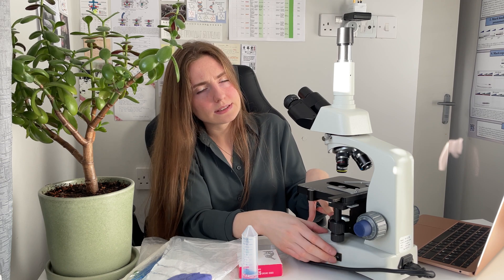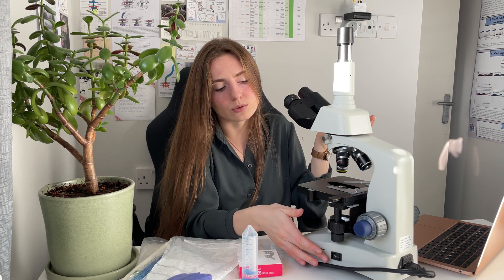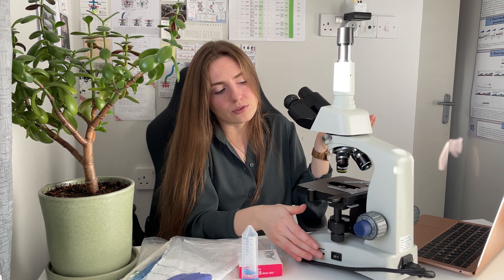We also have a torch here — you can see the light now. With this microscope I will be able to give more or less light to my sample. We also have a diaphragm which will help to work with the contrast of the sample. Those are the most important microscope parts we will be using today.